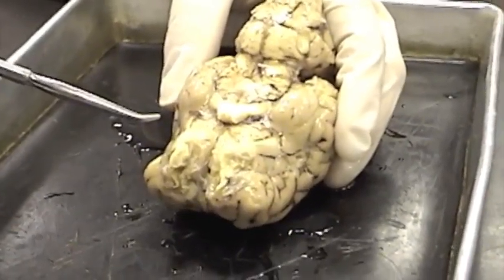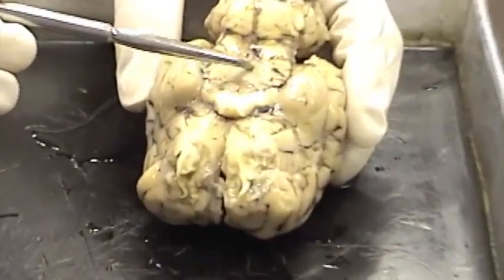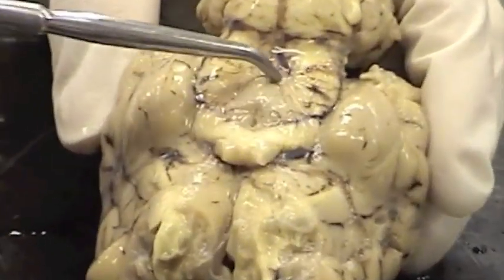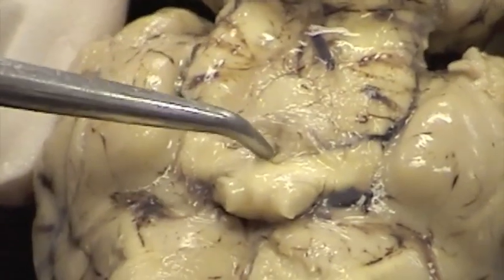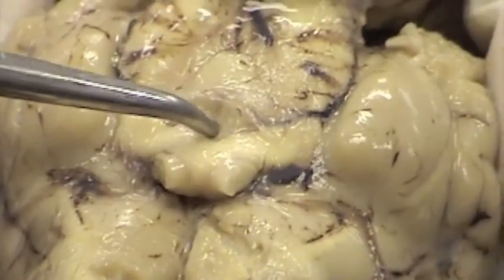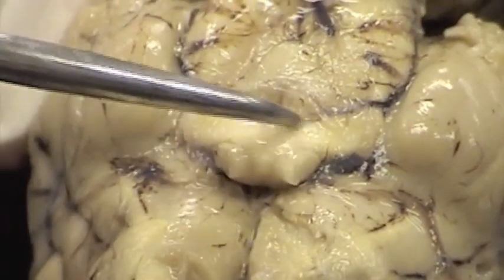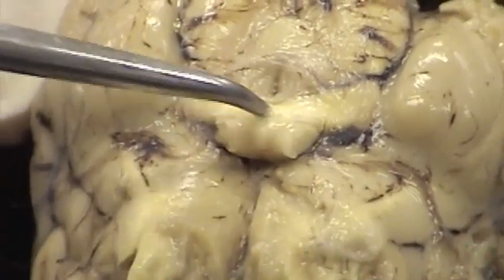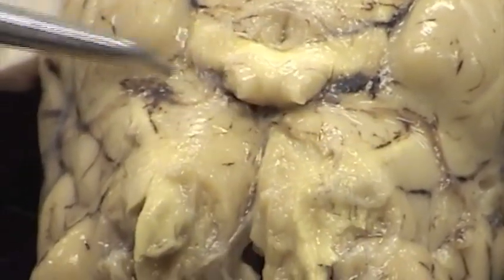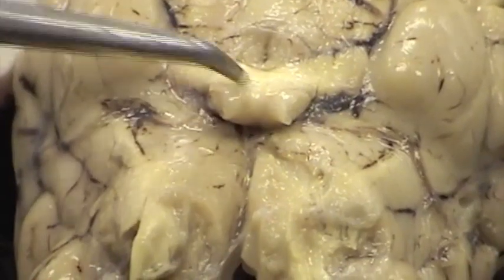On the inferior surface of the sheep brain we have several structures you're responsible for. One is the mammillary body — I'm outlining it here. This little structure is right on the midline, and on a sheep brain there is only one; on the human there are two. Slightly anterior to that is a hole — putting the tip of the probe in that hole — that is what remains of the infundibulum which dangled the pituitary gland. Above that is what remains of the optic chiasma, the crossing of the optic nerve. The optic nerve extended out on each side and had to be cut off in order to expose this area.